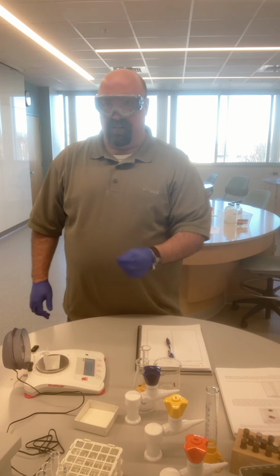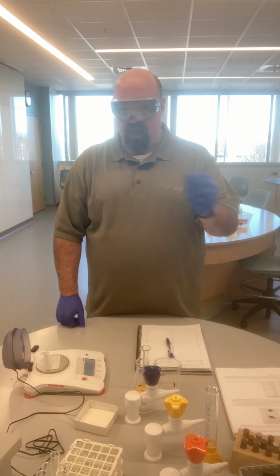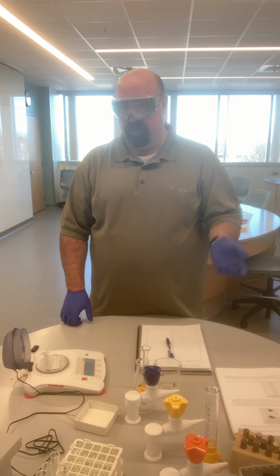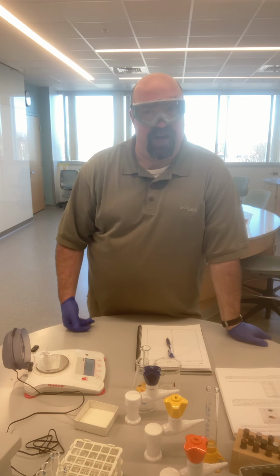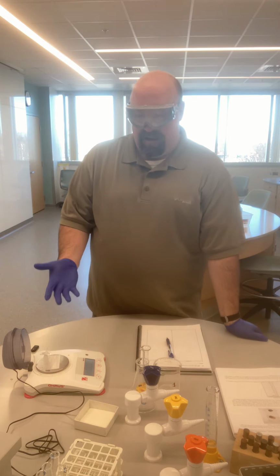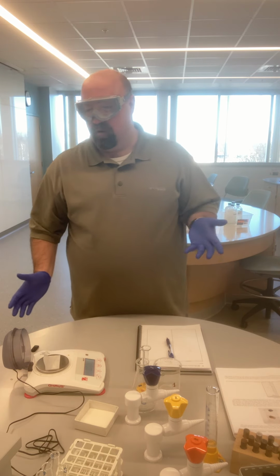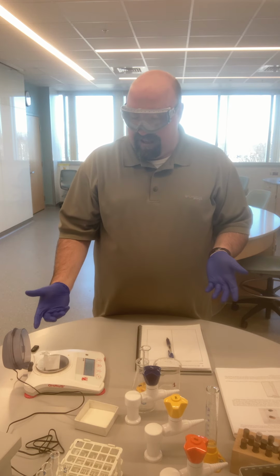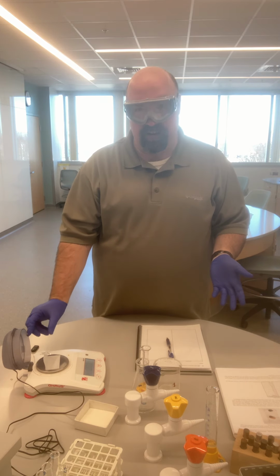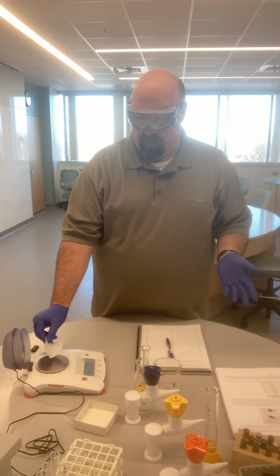And so now I can simply, if I want, say, 0.55 grams of something, I scoop my solid onto there, maybe my table salt or whatever it is, scoop that onto there until I get to 0.55 grams. Now I'm ready to take this and put it into whatever receptacle, whatever I'm going to run my reaction in maybe. Now, since I have this paper creased, it's a lot easier to pick up. I can sort of pick it up like this, and we would have something in here.